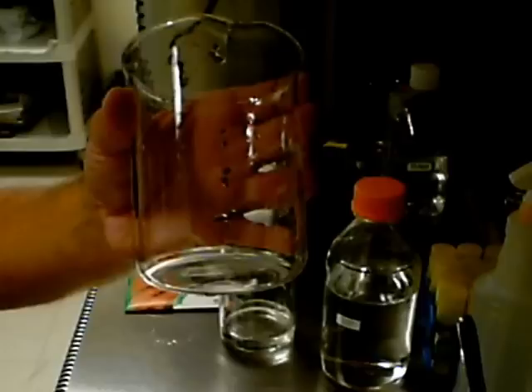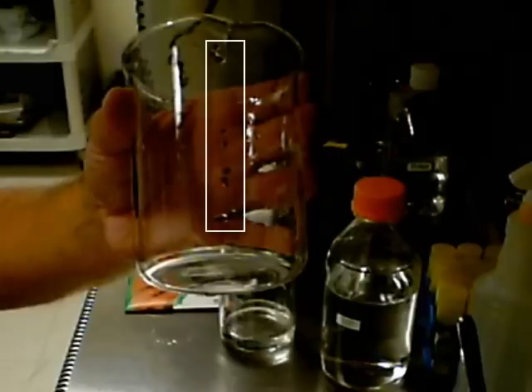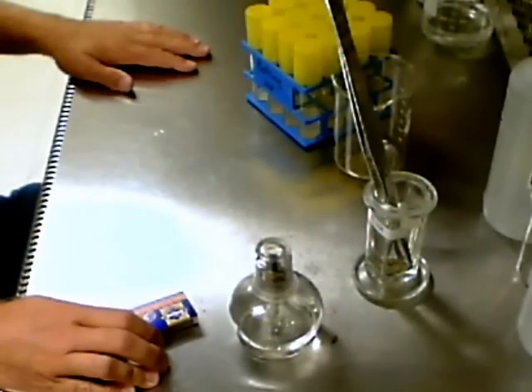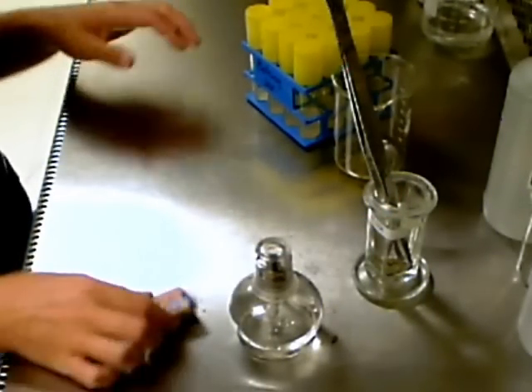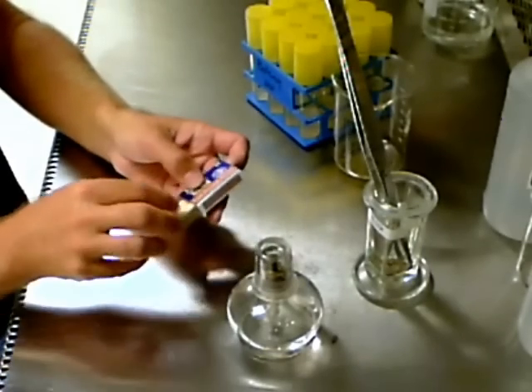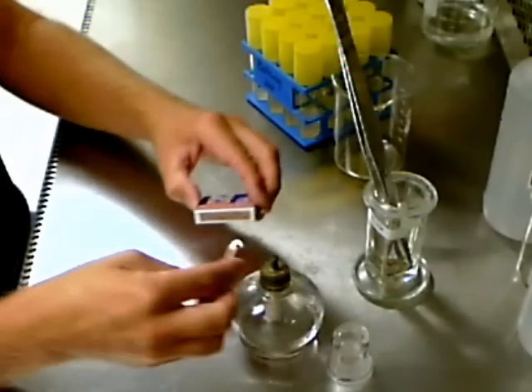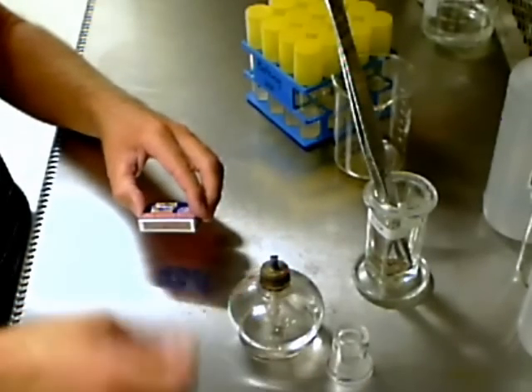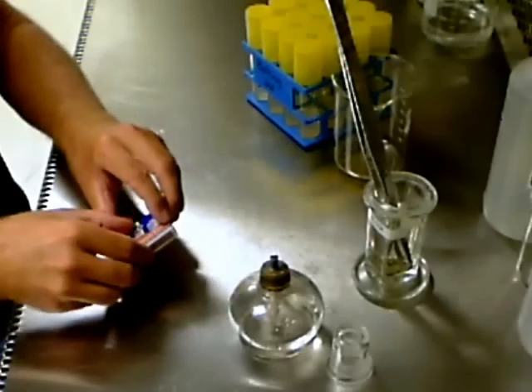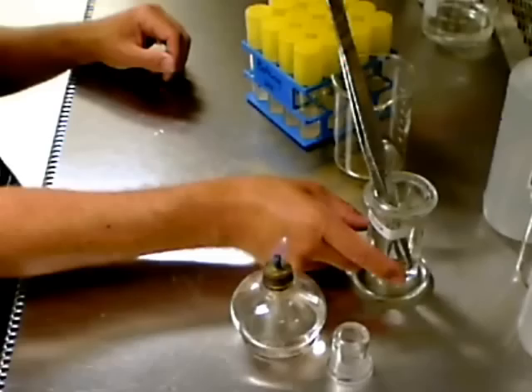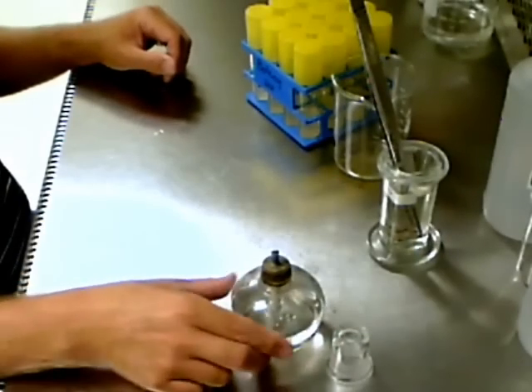You now have several seeds that have been surface sterilized and are ready to be placed on the germination medium. Begin by lighting the alcohol burner. The flame on the burner burns a cool blue that is almost colorless. Remove the forceps from the alcohol and pass them through the flame to sterilize, allowing the alcohol to burn off of the forceps and cool for a few seconds.